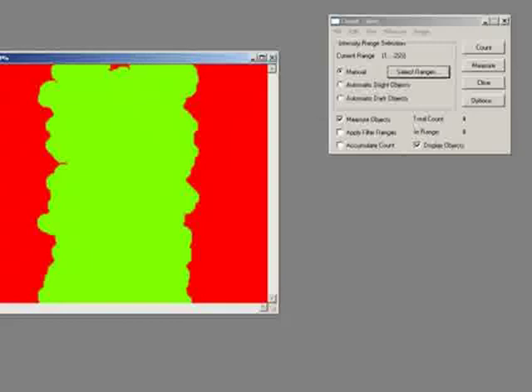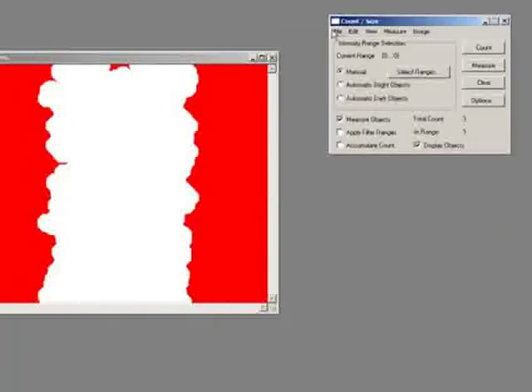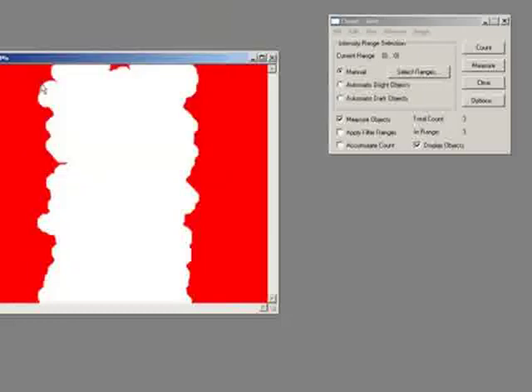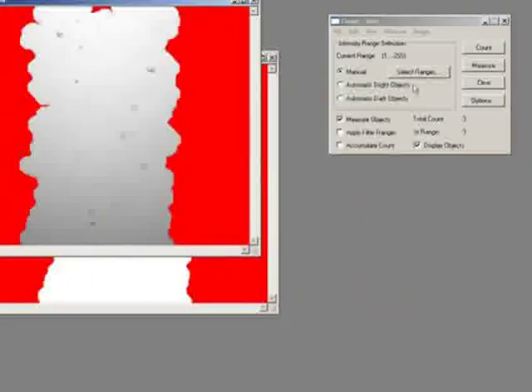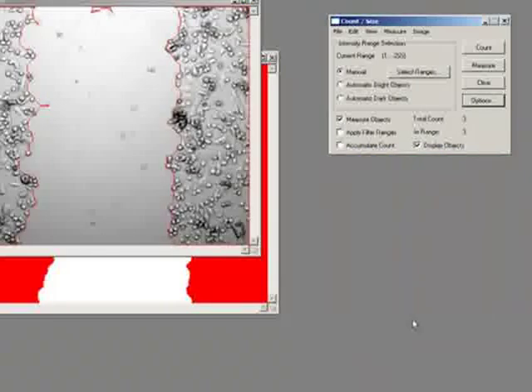Okay, cool. I hope that helps. Again, that's a pretty straightforward way of doing it. Also, let me just delete this other one, and we'll just count, and we'll save these outlines, and we'll save them just as an outline file. I'll just replace that, and we'll get the original image, and we'll put the outlines on. Load outlines, and options, and I'll just show you those as outline. And you can see that I've done a pretty good job of getting those major cell walls there.